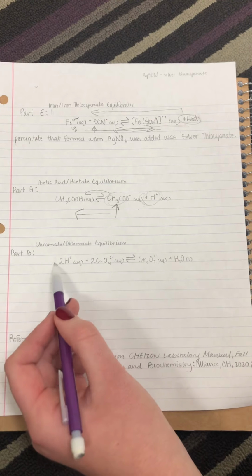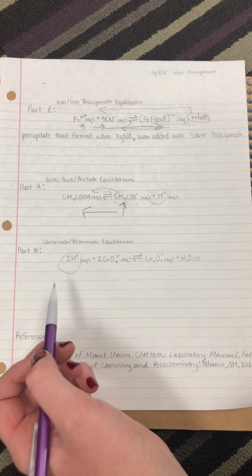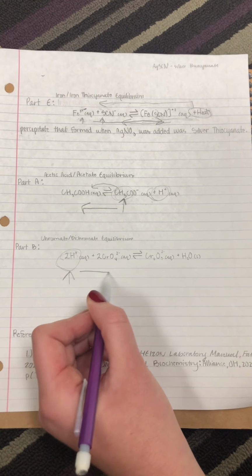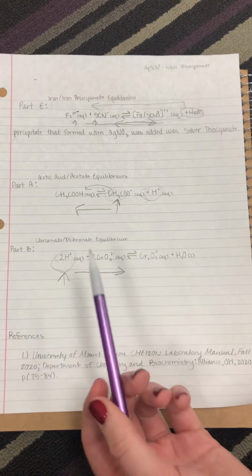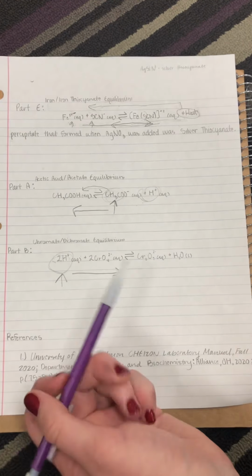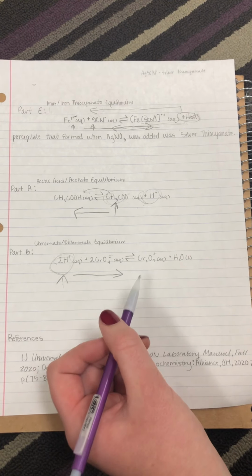This adds stress on the hydronium reactants due to the HCl being a source of hydronium ions. This applies stress to the reactant side, allowing for equilibrium to shift right. The addition of HCl causes chromate to react with the added hydronium ions, causing more products to form, which is dichromate, and this results in a more orangish solution.